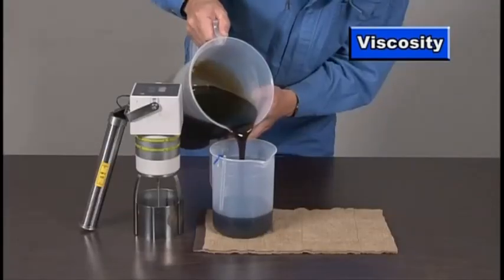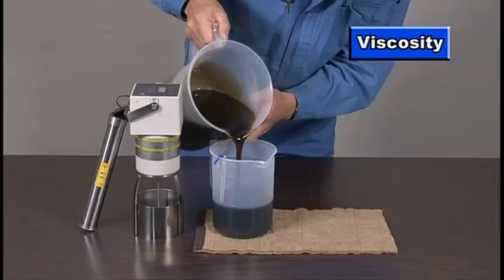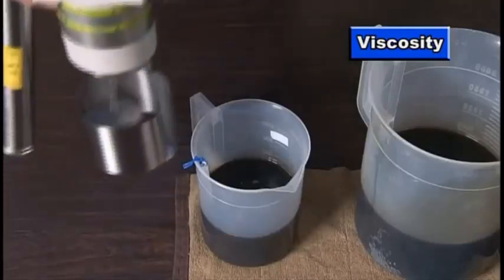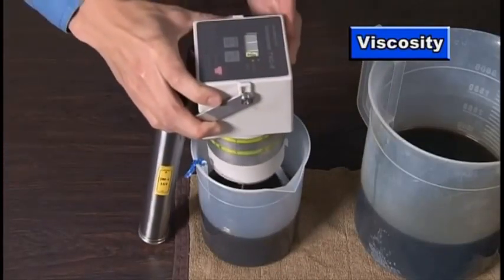Measure viscosity. Place a rotational viscometer in the oil.